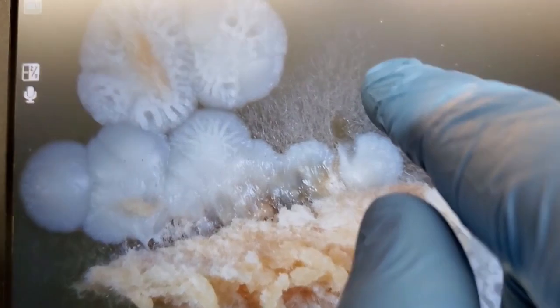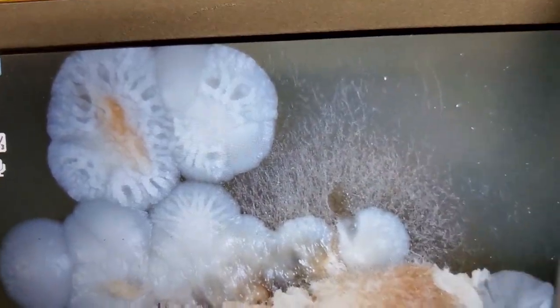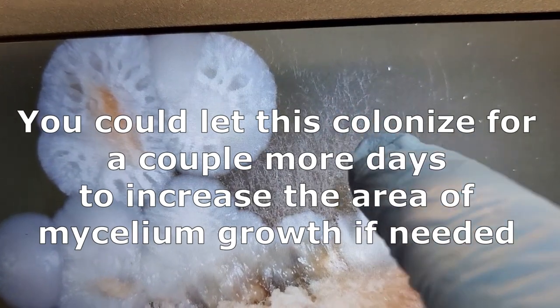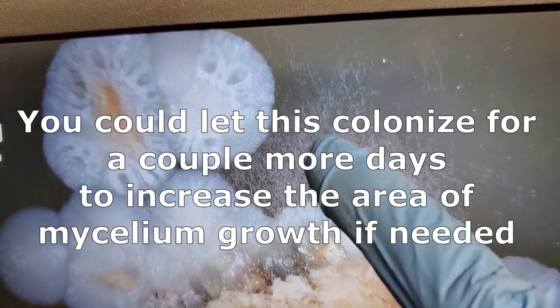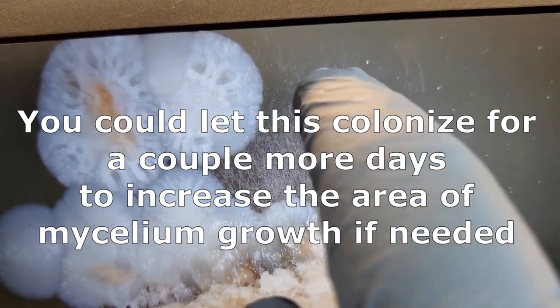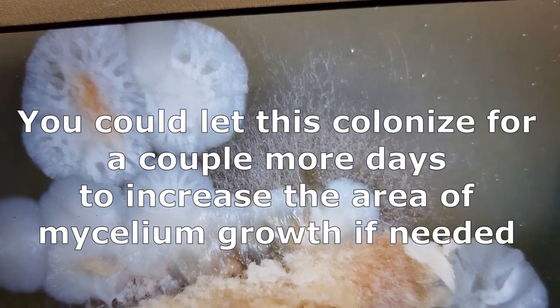But since, like I said, if this is the only thing that you have, or if you want a challenge, you see this part right here where we have this nice wispy growth of mushroom mycelium up here in this section. We could take a really small sample from this part right here, and we could transfer that onto another agar petri dish.